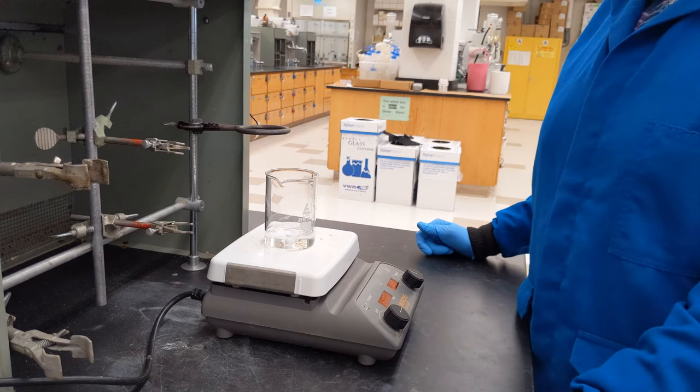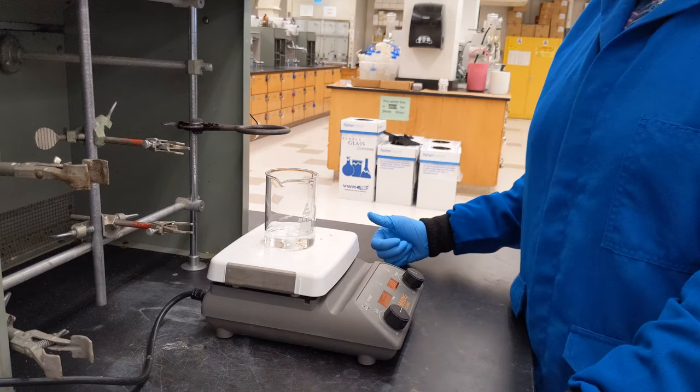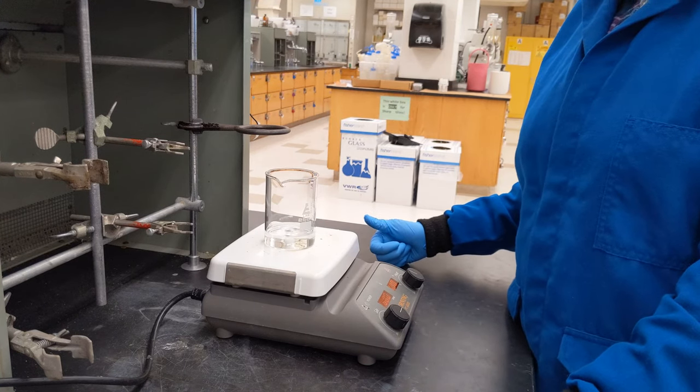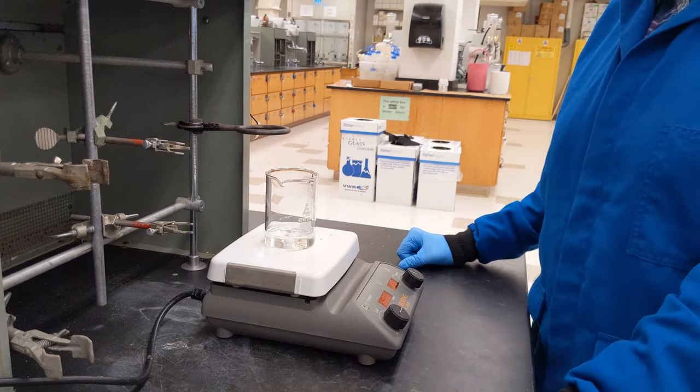Be careful because it is very easy to accidentally burn yourself. A cold hot plate looks exactly like a hot hot plate. So once it's on, do not touch the surface of it anywhere.